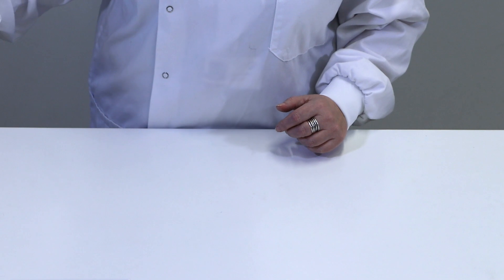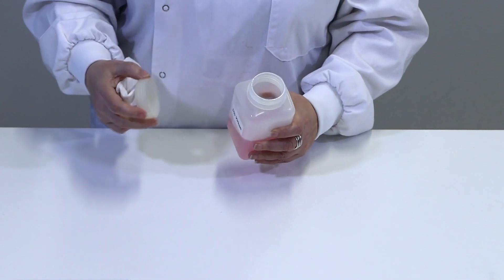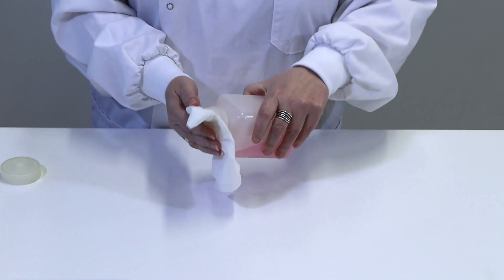For this part we're going to start by setting up a sterile zone to work in. First off we're going to take some freshly made disinfectant. This is Virkon, a multi-oxidiser to use.